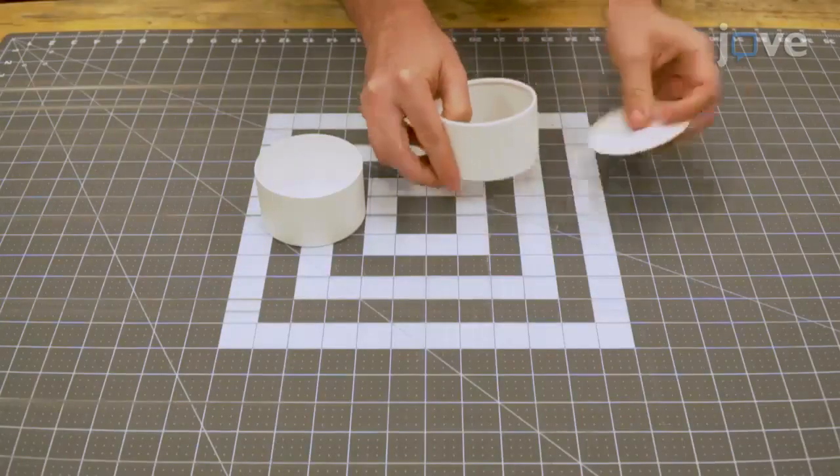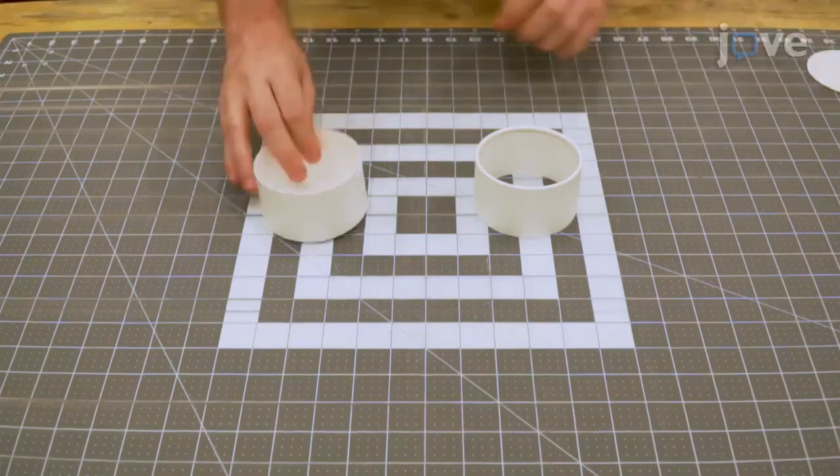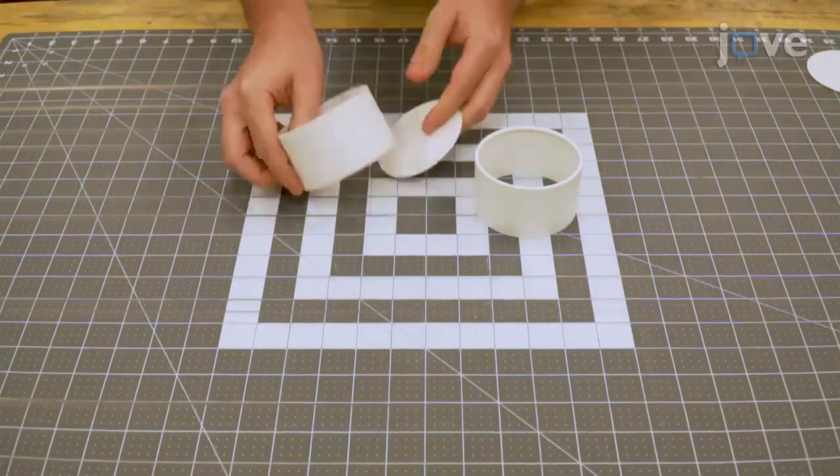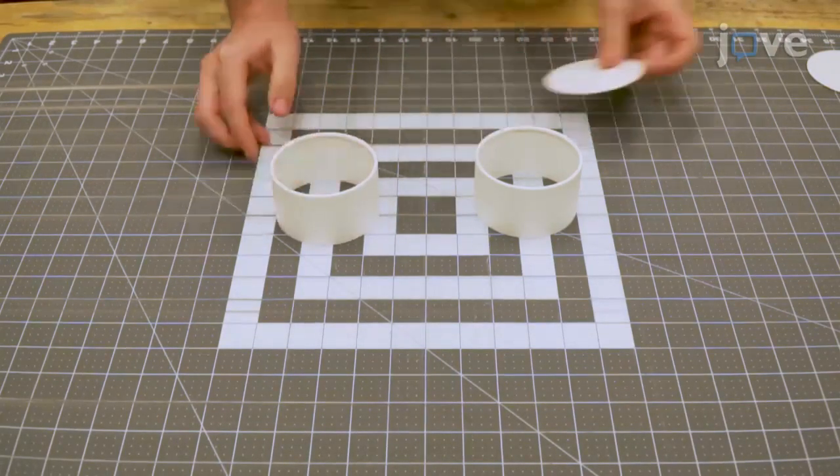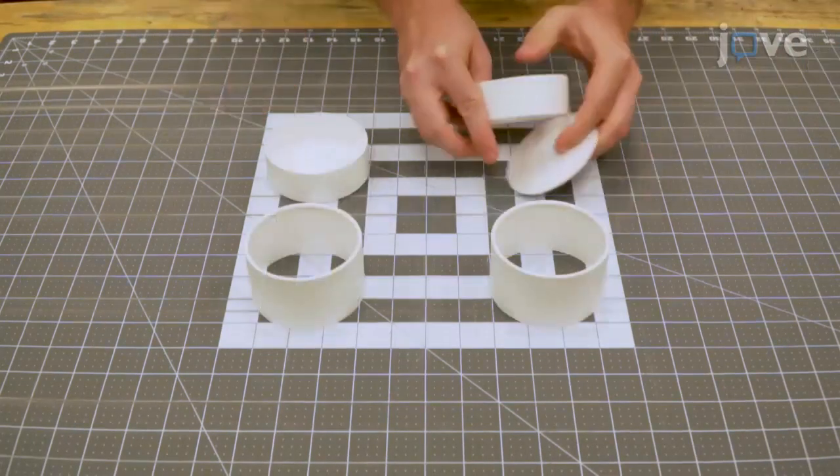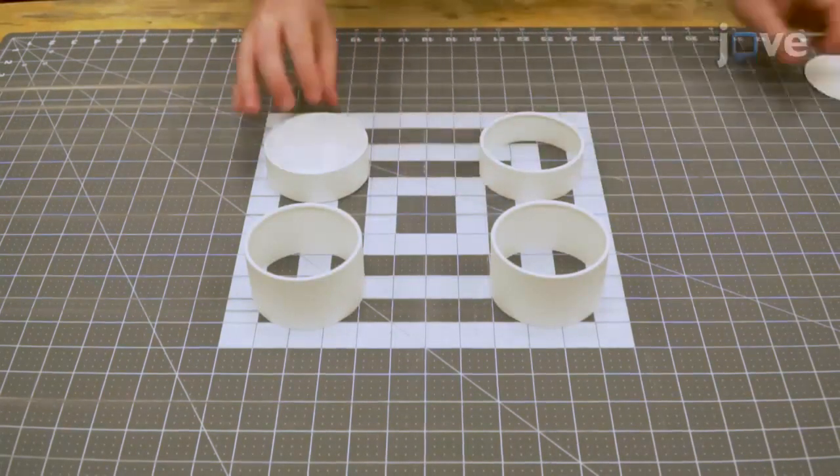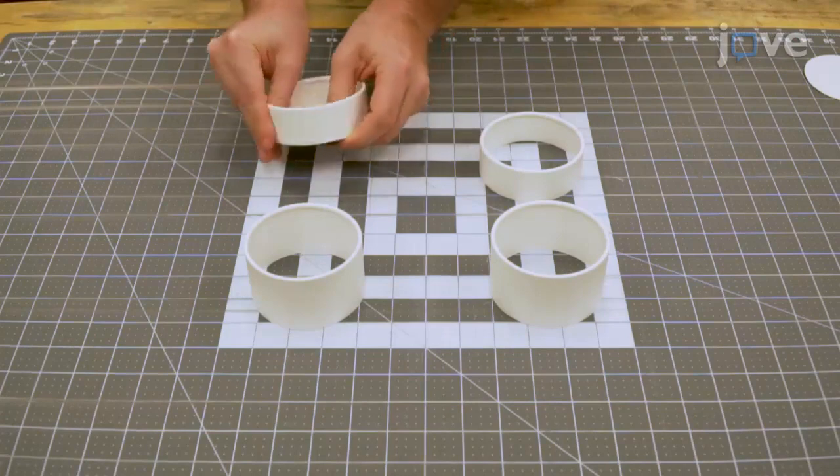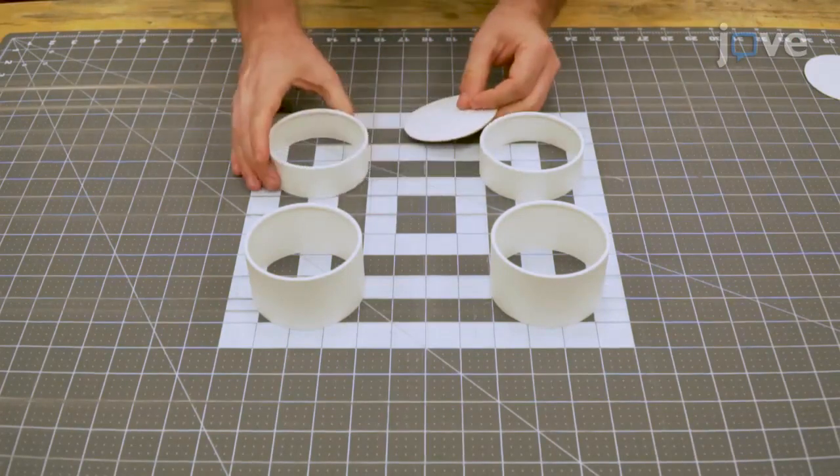Next, push the flat cardboard discs out of the bottoms of new half-pint cardboard ice cream cups to create open-ended 2x3-inch cylinders and remove the cardboard discs from two ice cream cup lids to create one open-ended bezel for each end of the cylinder.